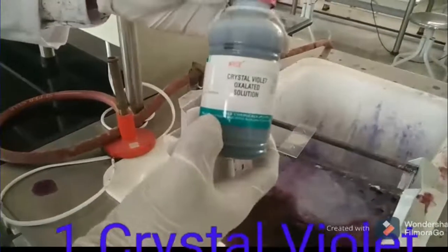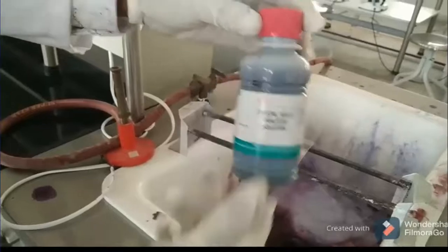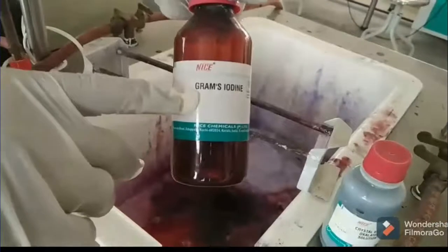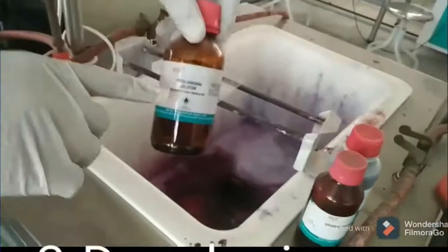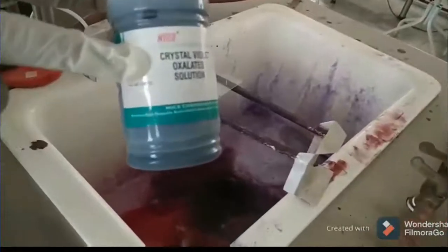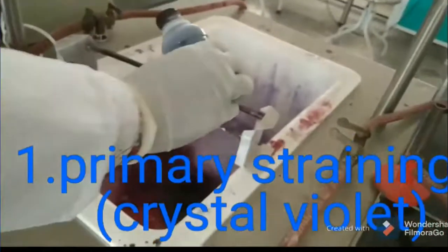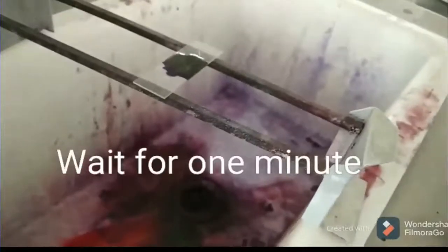The gram staining kit consists of four components. First is crystal violet, which is used as the primary stain. Second is gram's iodine, which acts as a mordant. Third is the decolorizer — either alcohol or acetone. Fourth is safranin, which is used as a counter stain.